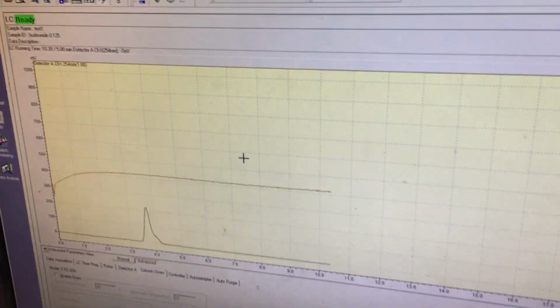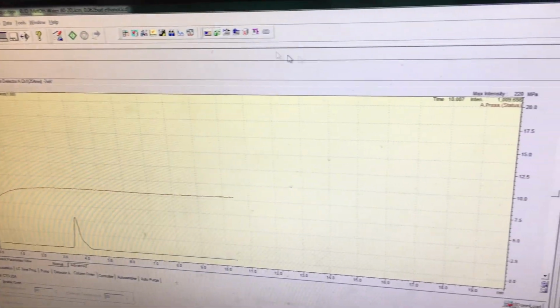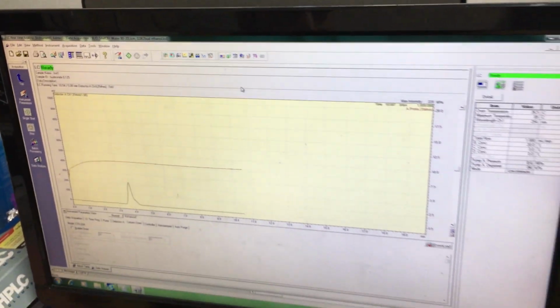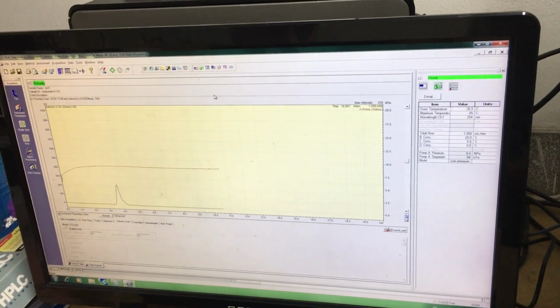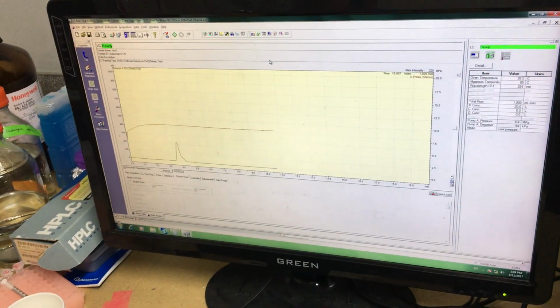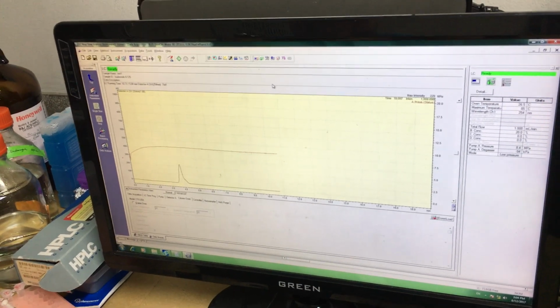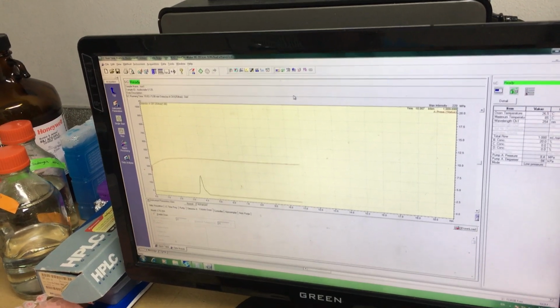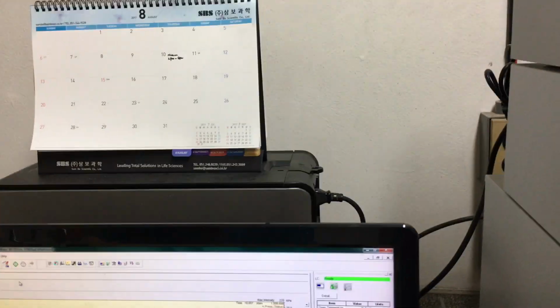And then go to the data acquisition. Whenever you finish your experiment, don't stop directly. Leave it running like 30 minutes, so the drug or polymer in the column should be washed. But if you use a buffer system, because buffer is not soluble in organic solvent, then you need to wash with distilled water only. Most columns break because of buffer. The salts precipitate if you don't wash. So after use, just leave it for 10-30 minutes and it will automatically wash.